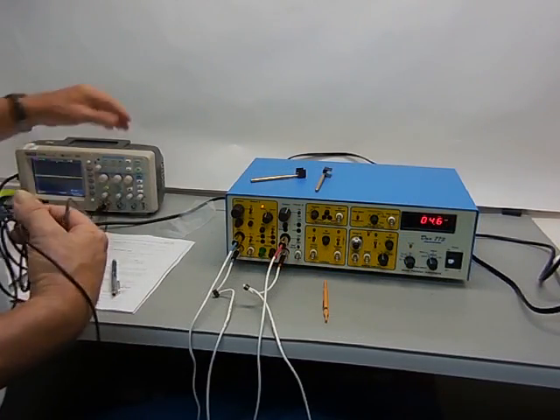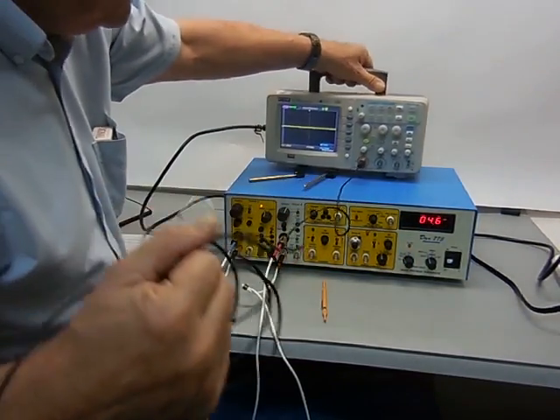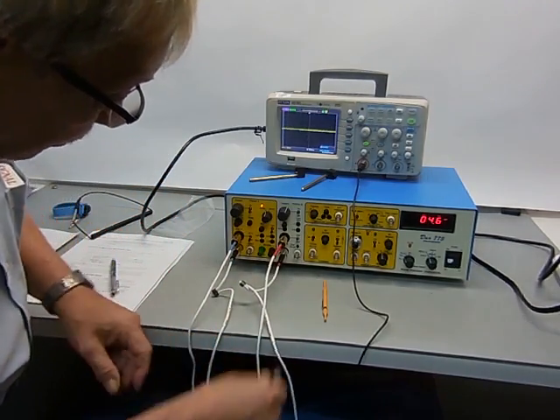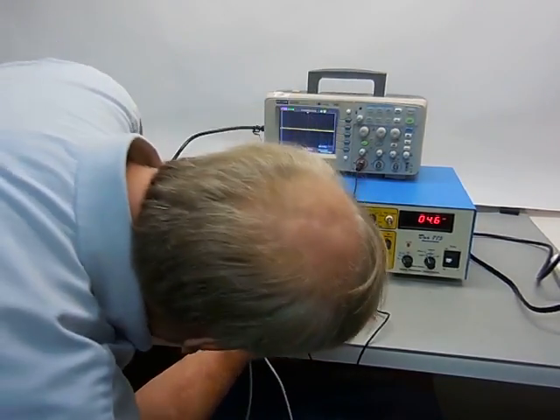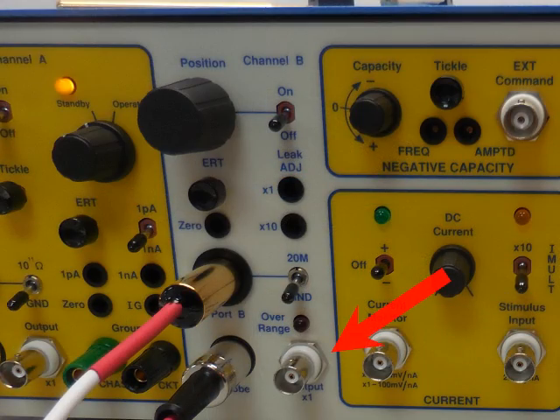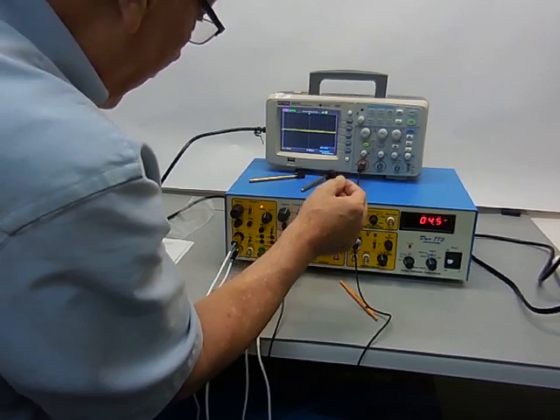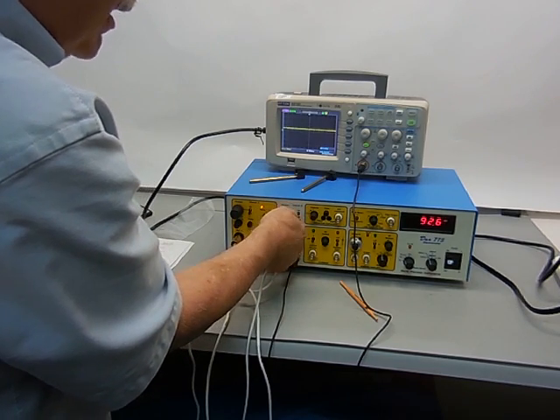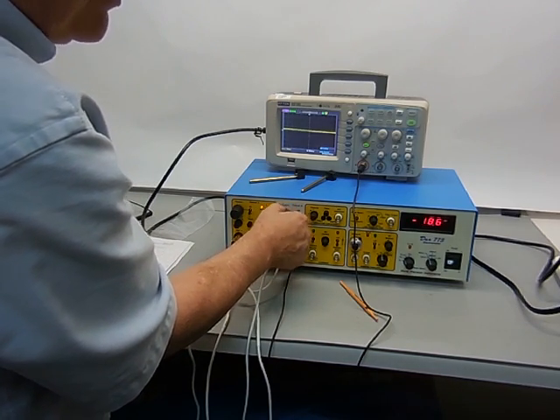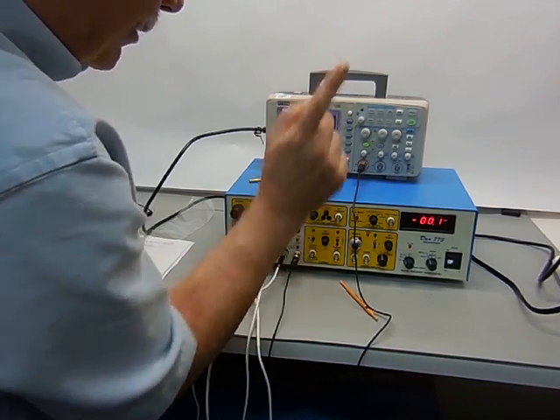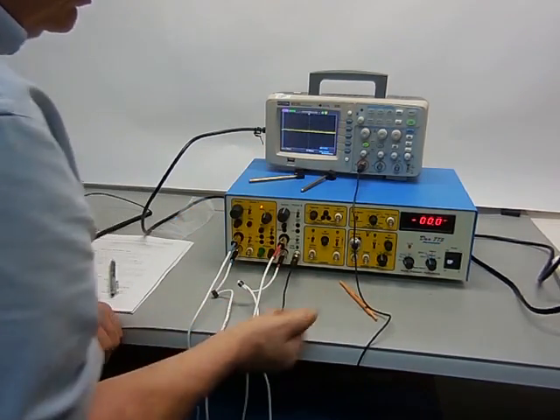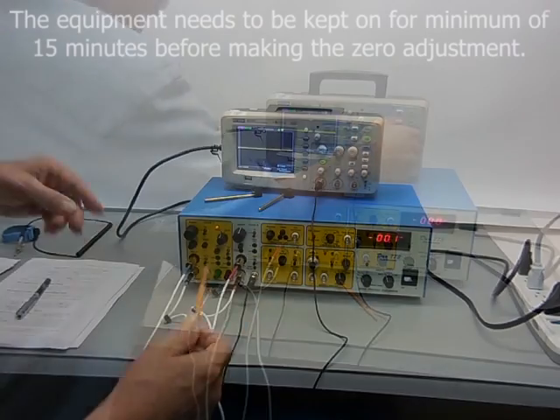We've got an oscilloscope here to monitor the 1X output for this channel. You should be able to see this change up and down as I turn this knob. It's a real slow sweep. If you turn it off, it goes back to zero again. You should see zero on the oscilloscope.